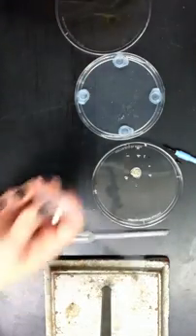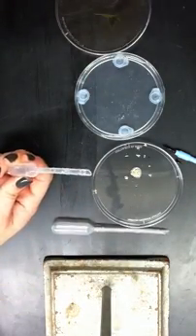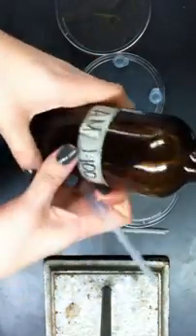To start off, you have to have a dedicated pipette, and we're going to test AM positive. So you have to dilute the AM, 1 in 100 dilution, with paraffin oil.